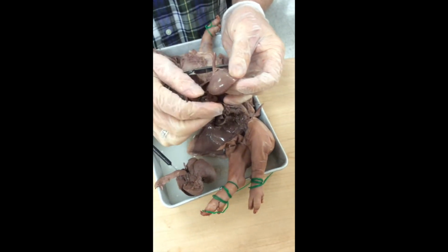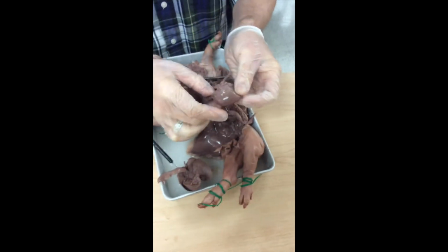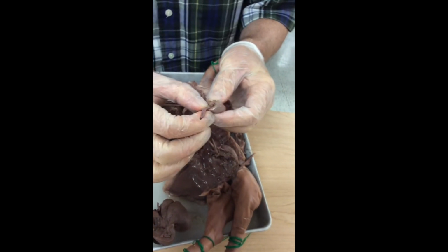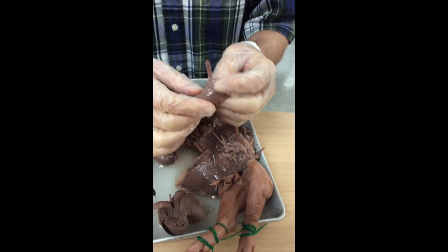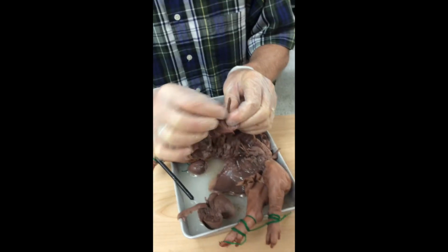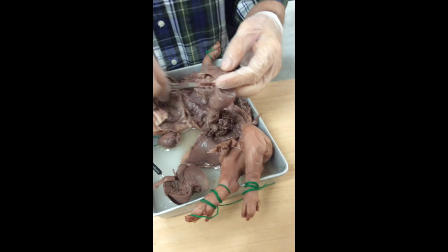The stomach itself is muscular, and so when it's time to evacuate, the stomach can compress and squish that stuff out of there. We'd also notice, again, where the esophagus enters the stomach, there's another sphincter, the esophageal sphincter, and that helps prevent stomach contents from going back up into your throat. Sometimes that sphincter leaks. That's called a hiatal hernia. So you've heard of that. That's going to contribute to some pretty serious heartburn.